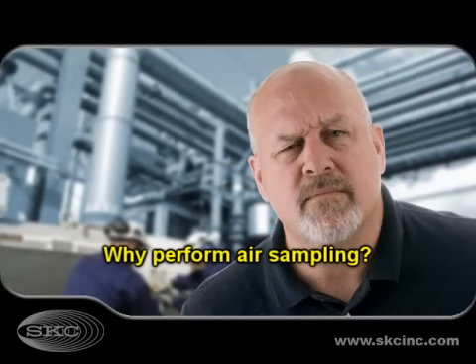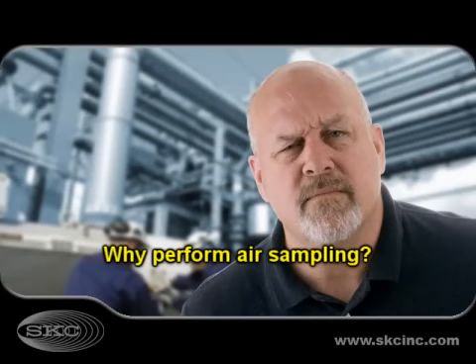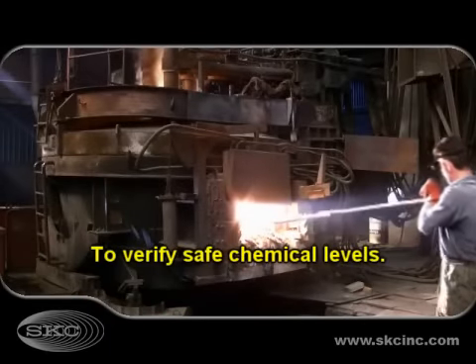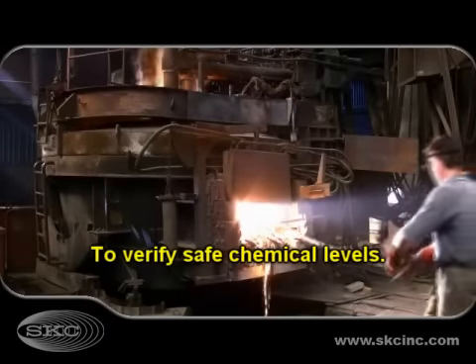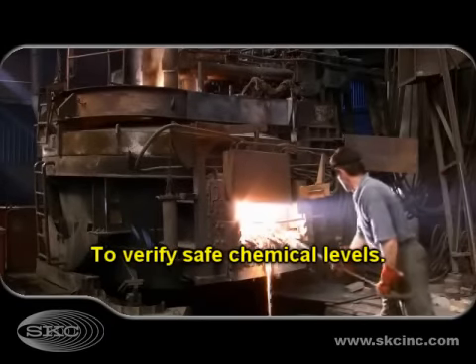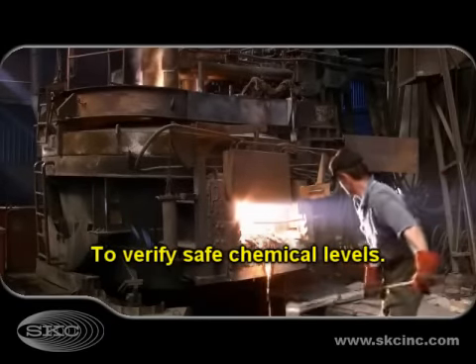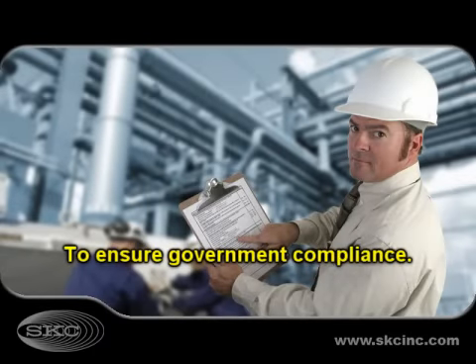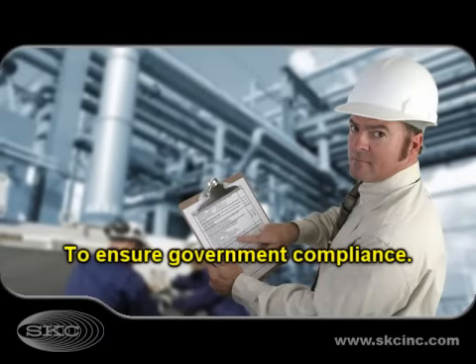Why do I need to perform air sampling? To verify chemical exposures are at safe levels and to ensure government compliance.